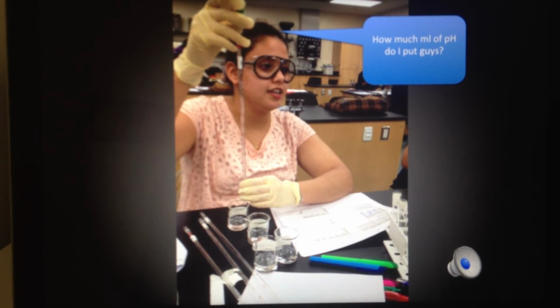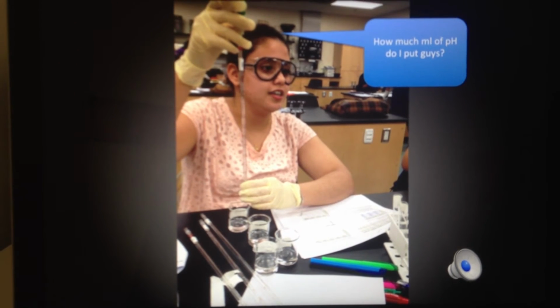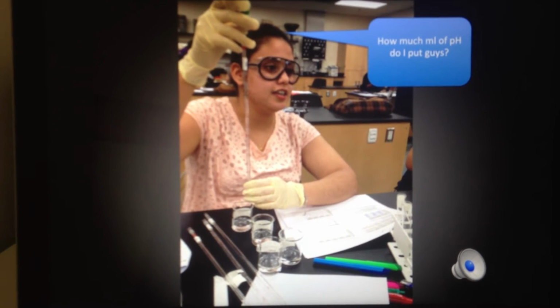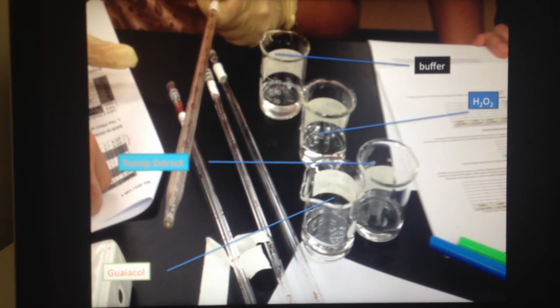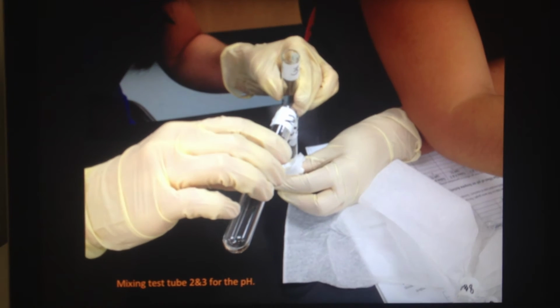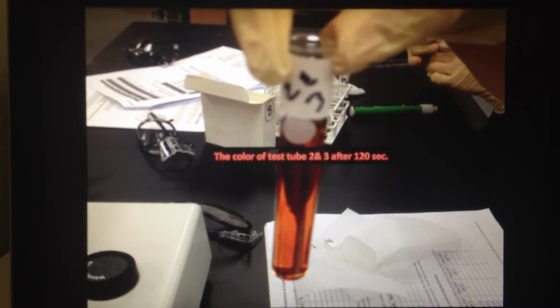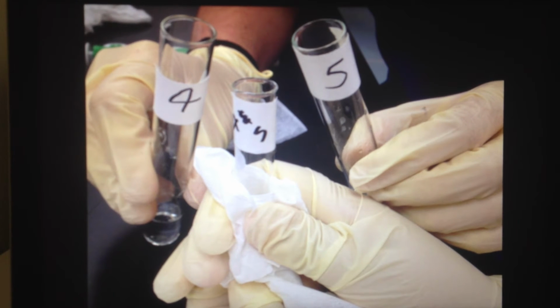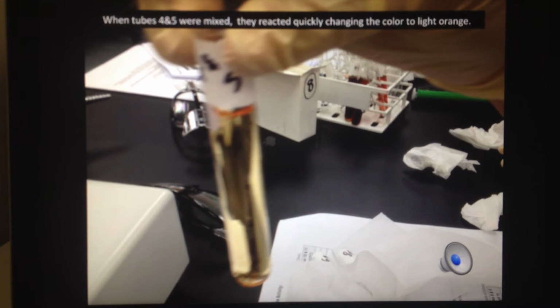To determine the optimal pH for peroxidase, different pHs were tested for the rate of peroxidase activity: pH 3, 5, 7, and 9. When tubes 4 and 5 were mixed, they reacted quickly, changing the color to a light orange.